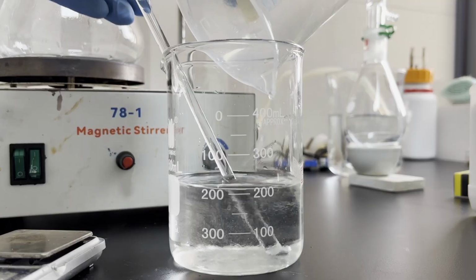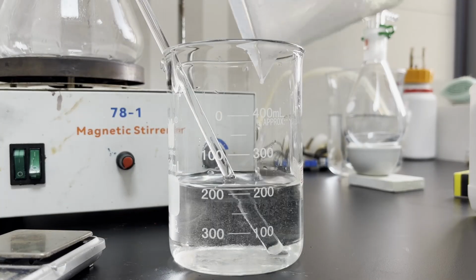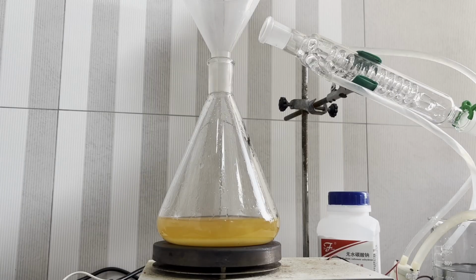I was testing this deficient amount because 1 mole of sulfuric acid can in theory release both of its protons and react to make 2 moles of hydrobromic acid. I thought I can get away with this, but in the end the yield is poor, so still try to use the more reasonable stoichiometry of 1:1 molar ratio.